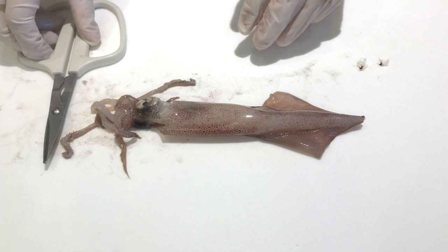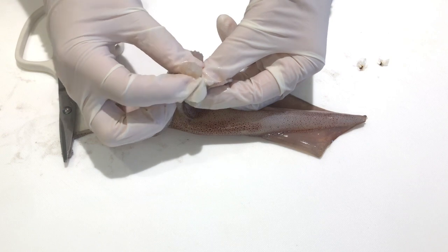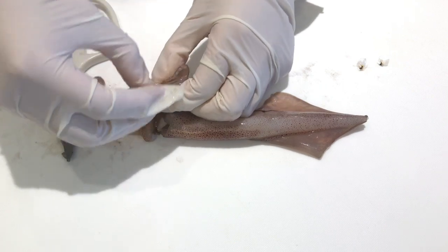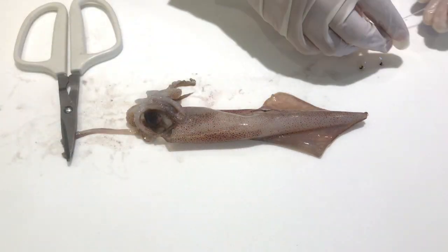Then I took out the brain, which comes out of the same white structure as the beak. I just squeezed it until it popped out, which was a pretty traumatizing process. You can also see that the nerve came out as well — that's the long structure right there.